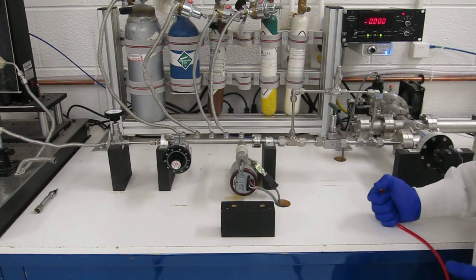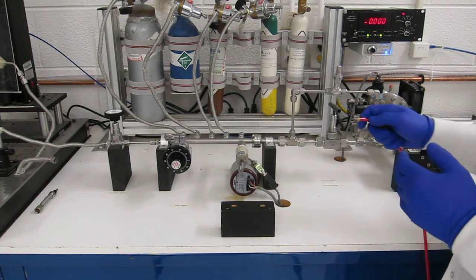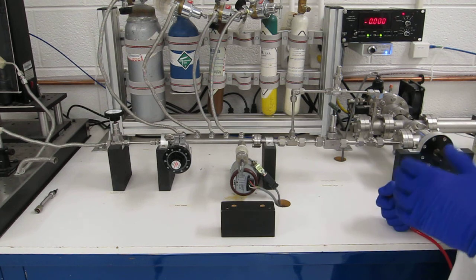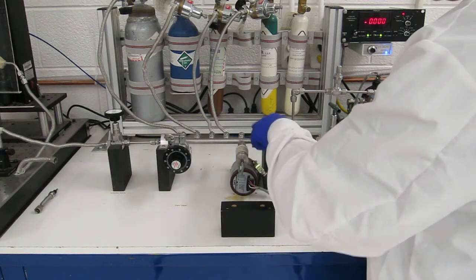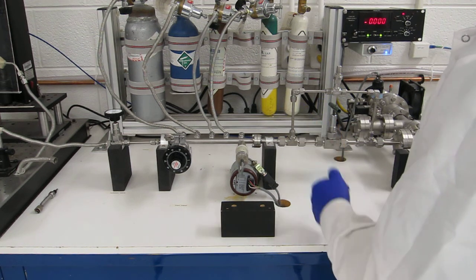Be careful, however, in that some types of O-rings are permeable to some extent to helium. In other words, if you take helium and you waft it long enough over some of these O-rings, they will start to leak regardless, because some of the helium simply diffuses right through the rubber. In this particular system, these are all metal O-rings and metal connectors, so there's no fear of that happening. But again, if you have rubber O-rings, be careful.